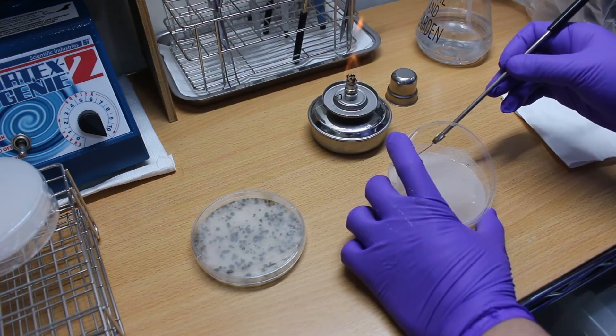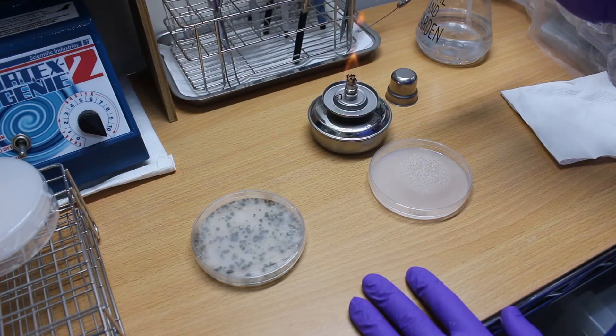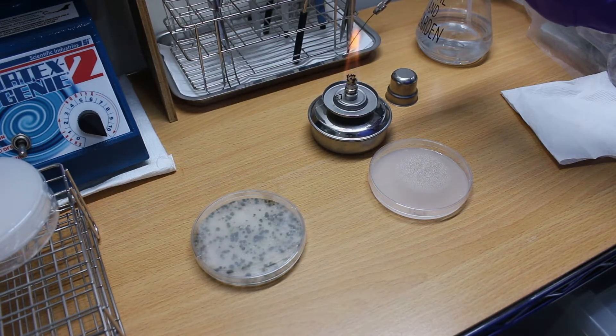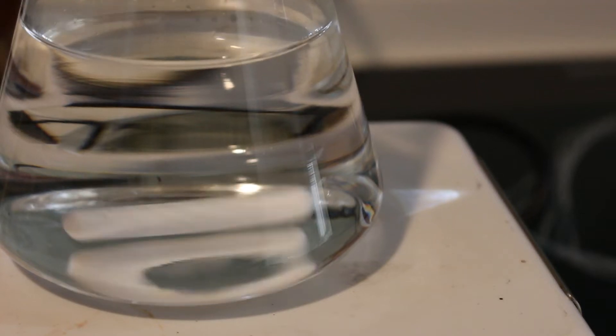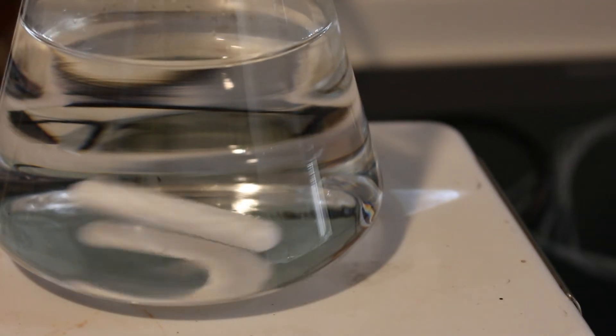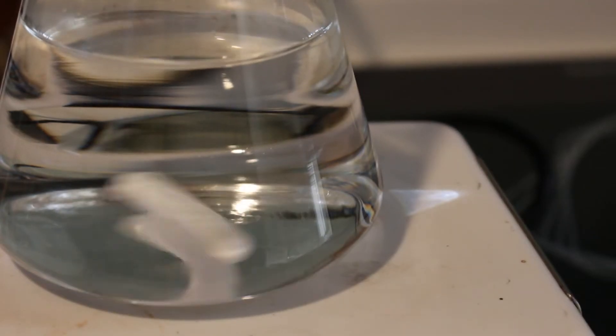Don't be discouraged if you don't find any PSB. PSB are quite common, and if you haven't found any after trying on like 10 or more plates, it's probably a sampling problem or an error in the culture medium. You might need to start all over.